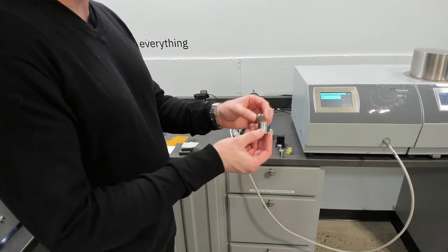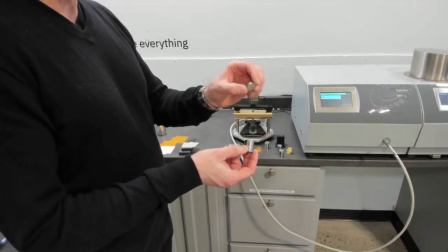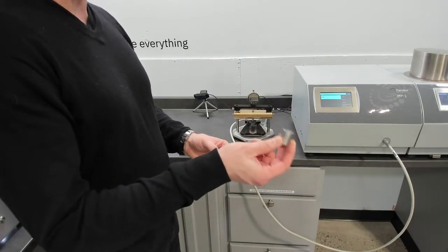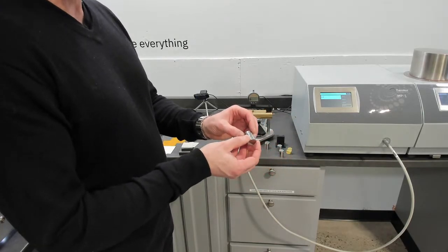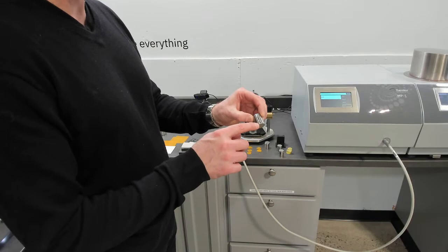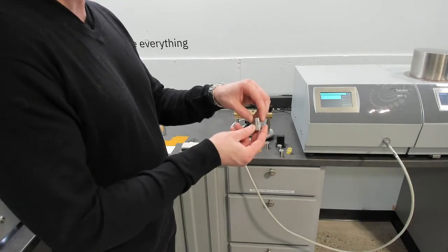These are our standard pieces of two objects, stainless steel. Piece A is three millimeters, 21 millimeters diameter. Piece B is stainless steel, the same diameter, 25 millimeters. So we're measuring through piece A and into piece B, which is a semi-infinite body. Anything we introduce between piece A and piece B, we measure the resistance of.